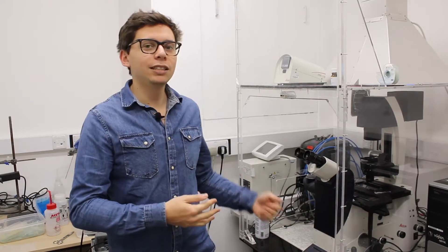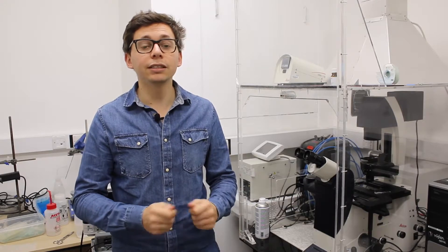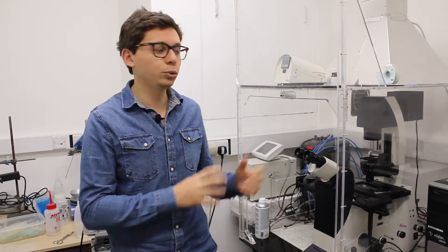So this is how you turn on and off the lamp, how you change the filter cubes on the filter wheels, how you can adjust the intensity or the irradiated area on your sample to do the fluorescence acquisition on the Leica microscope. Some general remarks to conclude.